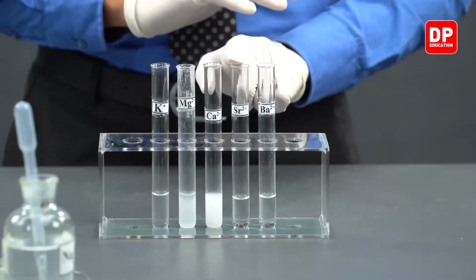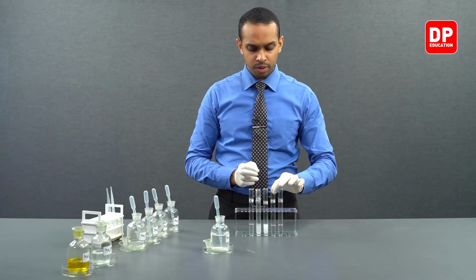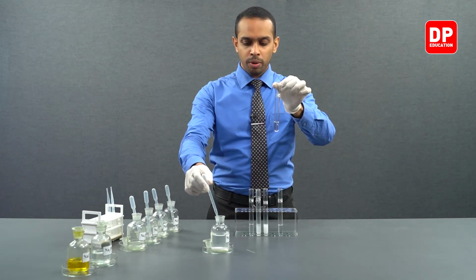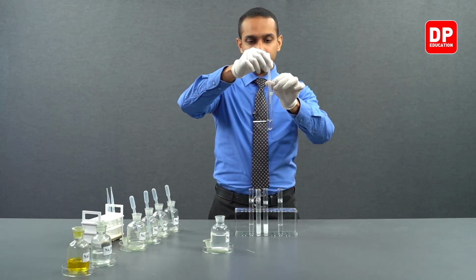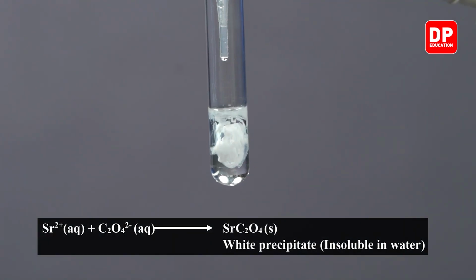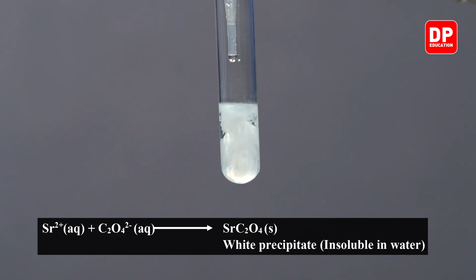Then let's move on to our strontium 2+ aqueous ion solution. Let's take our strontium 2+ aqueous ion solution and add a small amount of sodium oxalate. Again, you might see upon addition of just one drop, we have a white color precipitate formed.